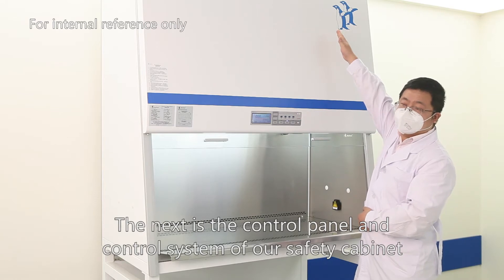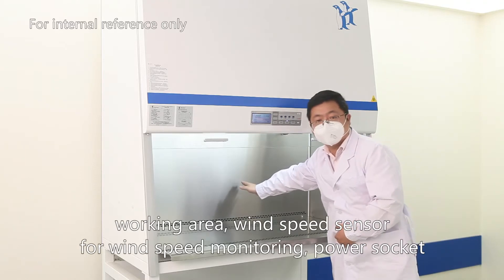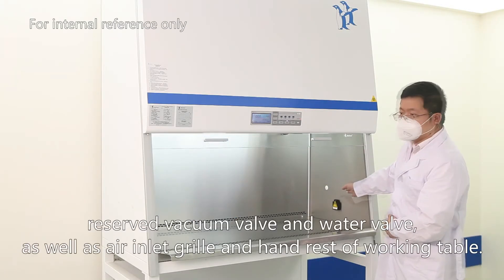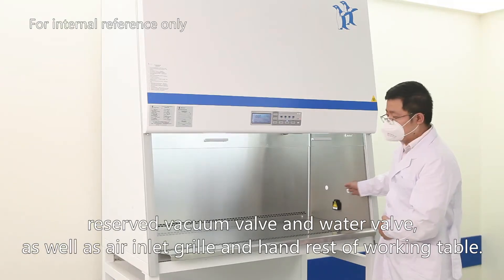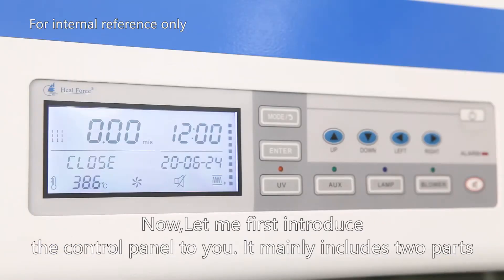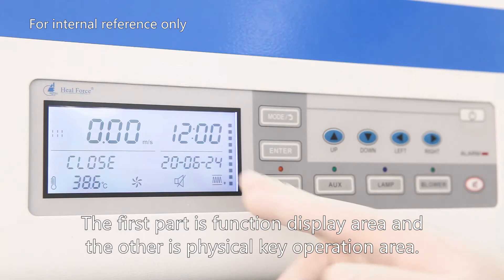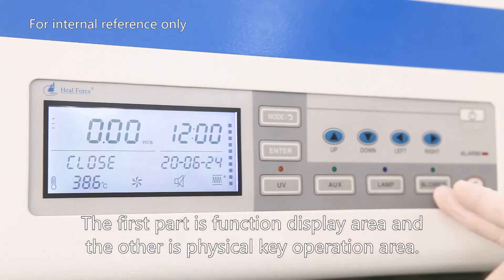The next is the control panel and the control system of our safety cabinet, including the working area, wind speed sensor for wind speed monitoring, power socket, reserve vacuum valve and water valve, as well as air inlet grill and hand rest of the working table. Now let me first introduce the control panel to you. It mainly includes two parts: the function display area and the physical key operation area.